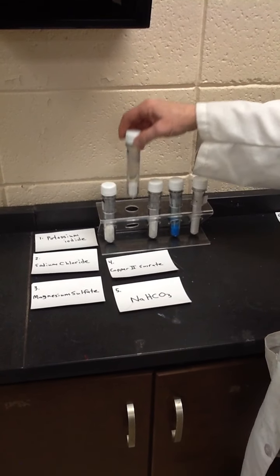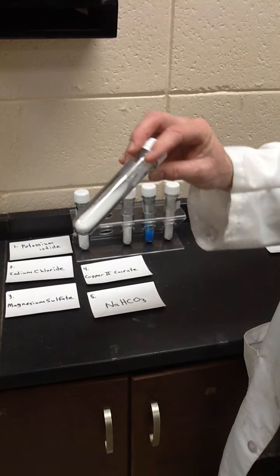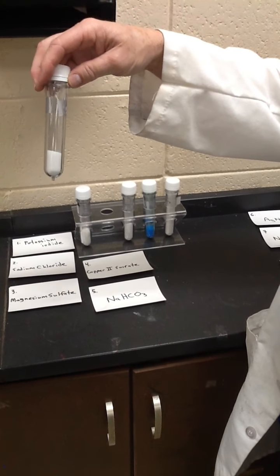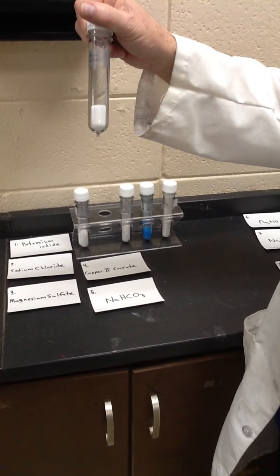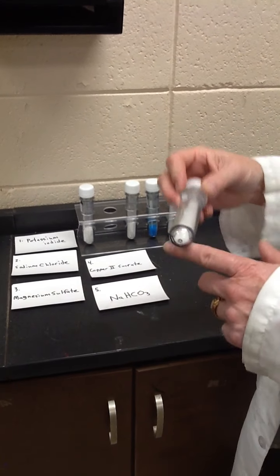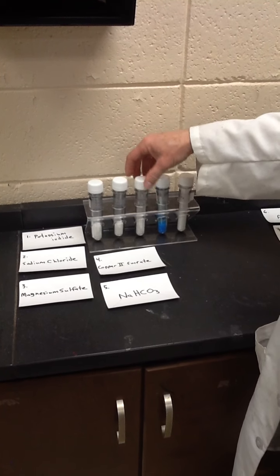The second one is sodium chloride, plain old sodium chloride. This is my laboratory grade sodium chloride. It doesn't have sand in it or silicon aluminum carbonate or whatever they put in the Walmart salt. Yes, there's sand in there. That's why it's cloudy when you make your salt solutions. But that keeps the salt from clumping. Though nothing helps completely in Arkansas. We're very humid here.